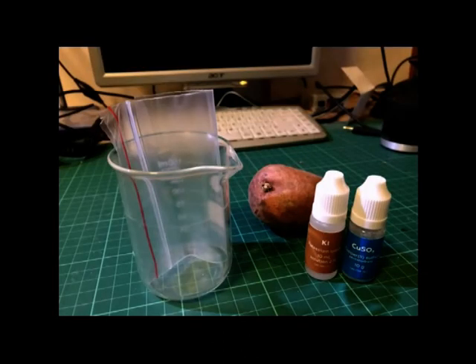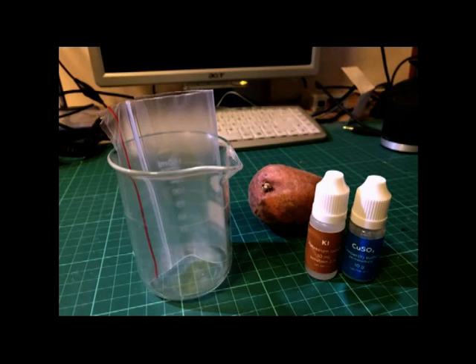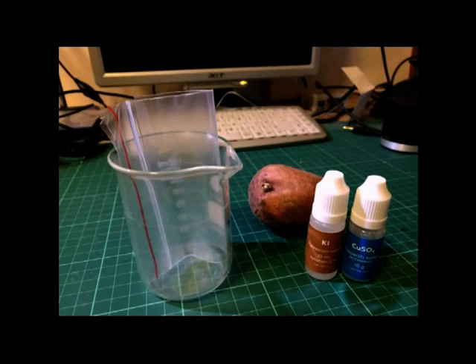To do this experiment you will need a beaker, a polyethylene bag, a potato, potassium iodide and copper sulfate.